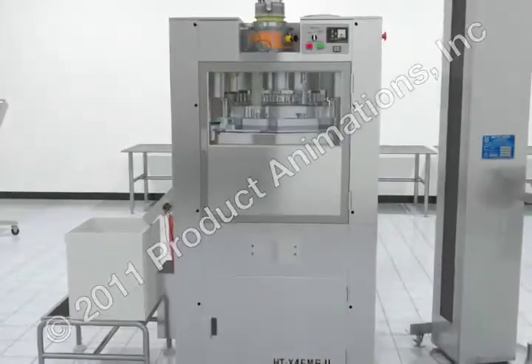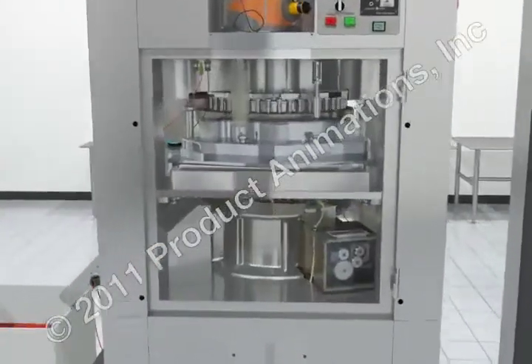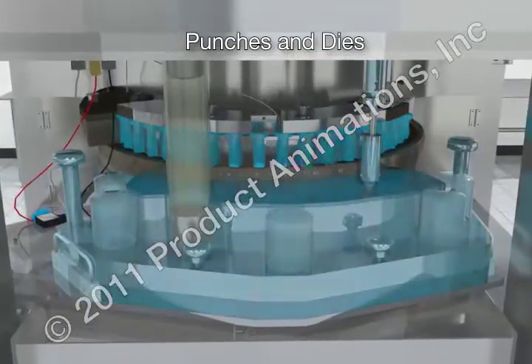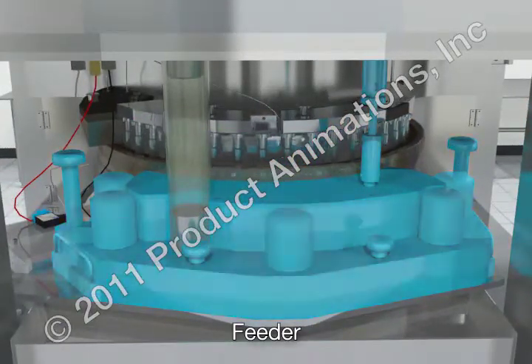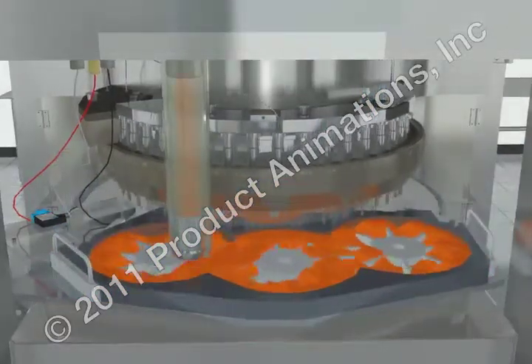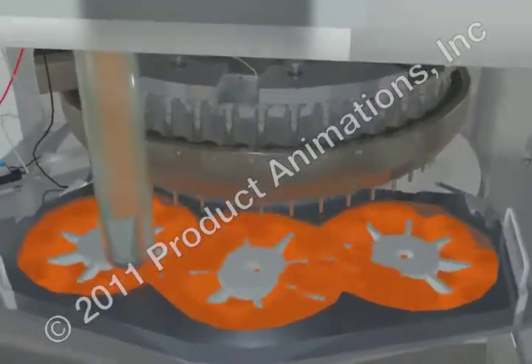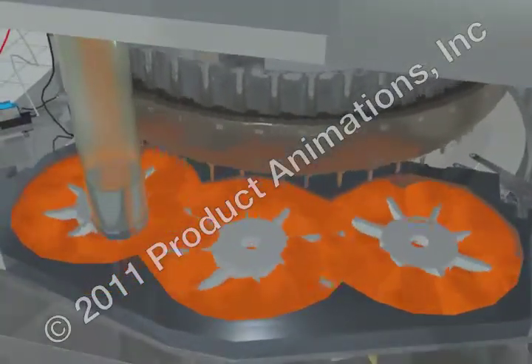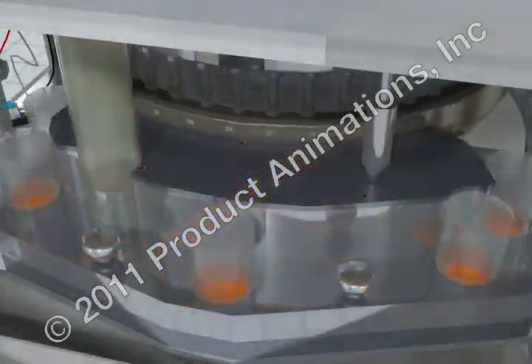During the filling stage, the turret, along with its complement of upper and lower punches and dies, rotates past the feeder. The feeder contains the granulation used to manufacture the tablet. Inside the feeder are mixing paddles that ensure a consistent flow of granulation into each die. The mixing paddles will rotate continuously as long as the press continues to run.